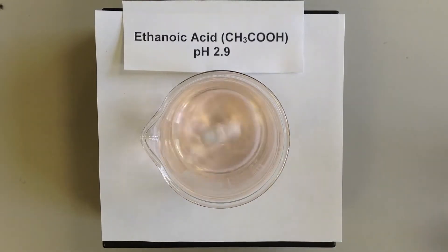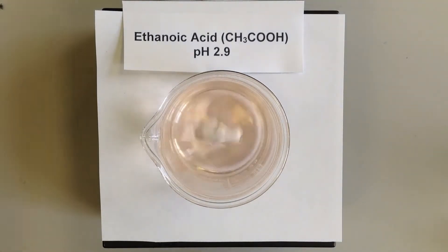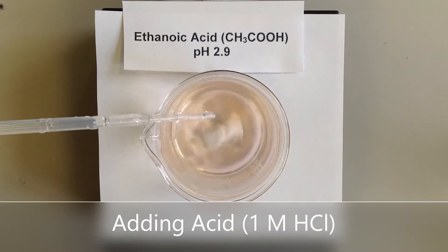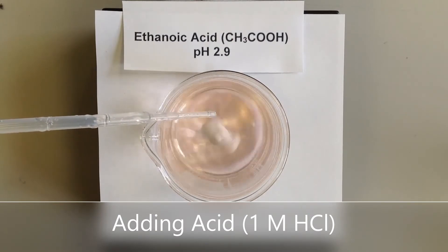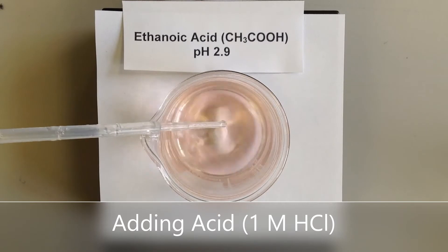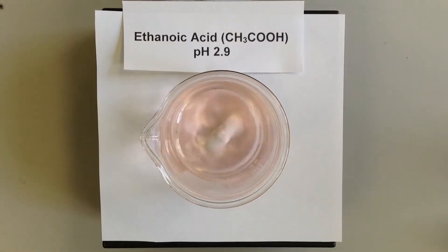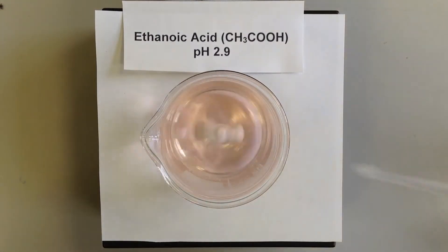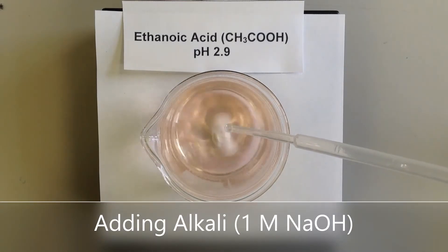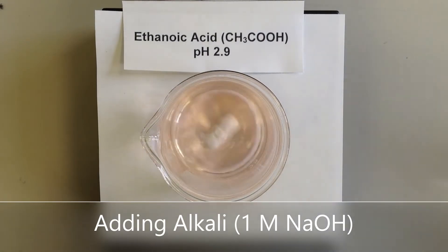Now it's at that value, I'm going to add some hydrochloric acid to this. Notice that the pH is not changing very much at all — pretty steady. It's got a little bit more acidic. And I add a bit more alkali again — not massive pH changes.